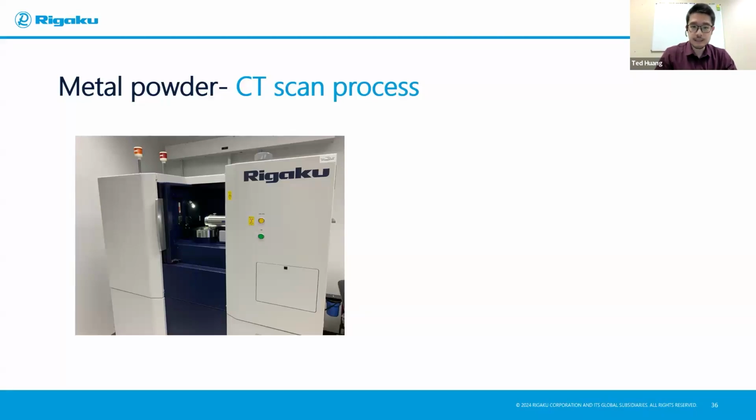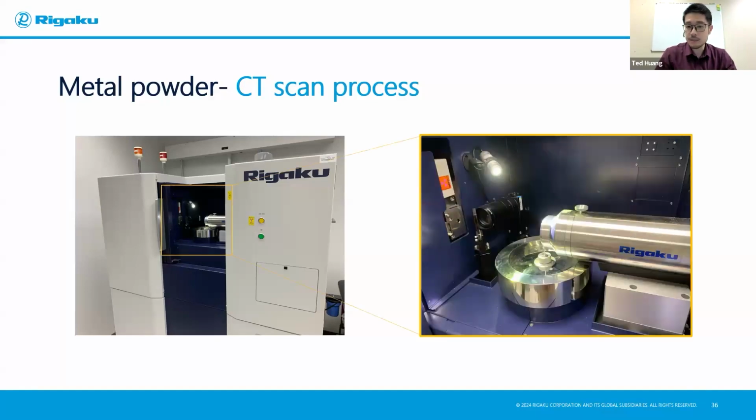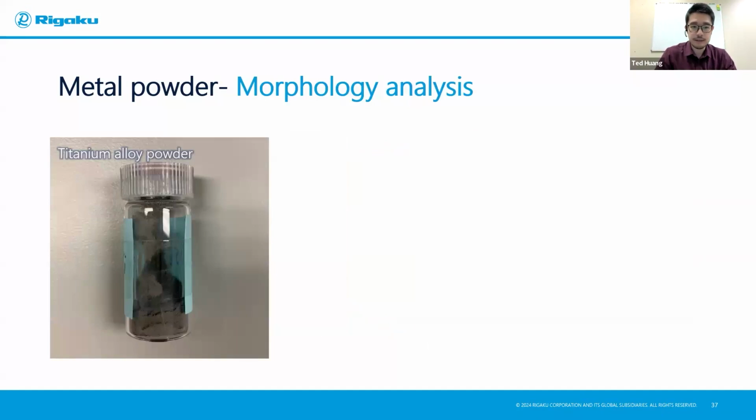Here is a Nano 3DX. It is a parallel beam system like this you can see here. So it has a smaller field of view for you to image your sample, but it has way higher resolution, in this case, the finest voxel resolution down to 325 nanometers. So what I'm imaging here is these titanium alloy powders you see on the left-hand side in the vial.